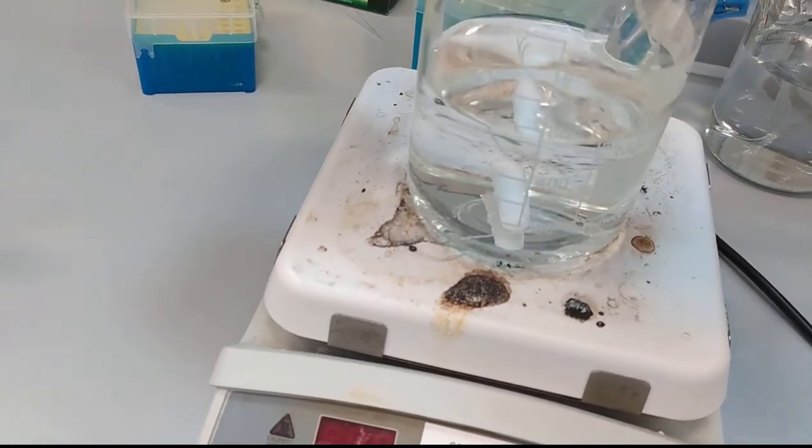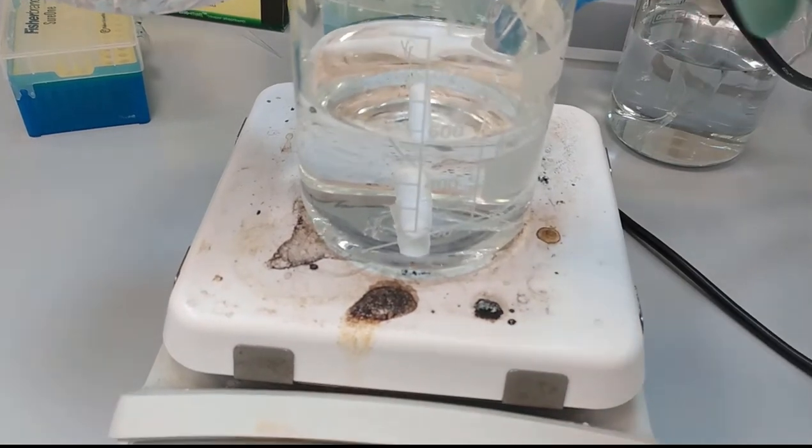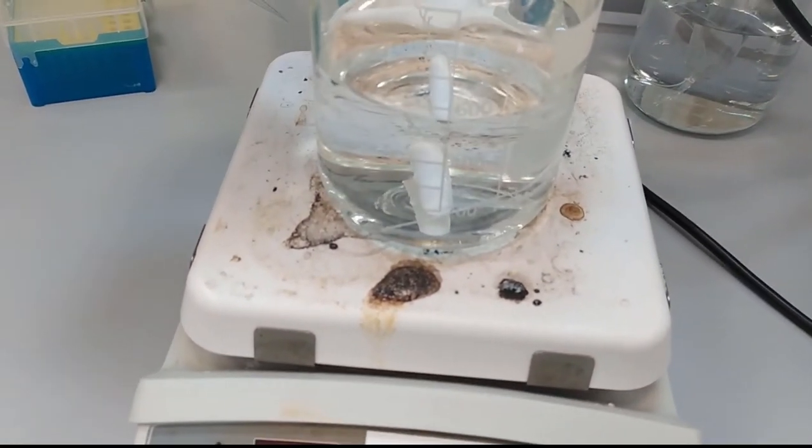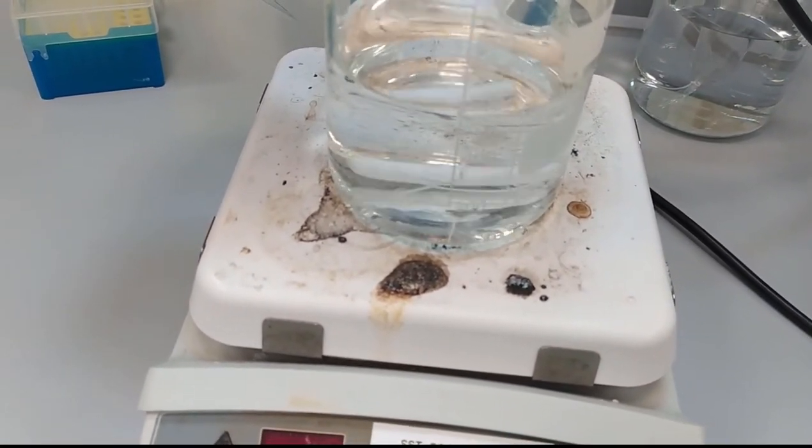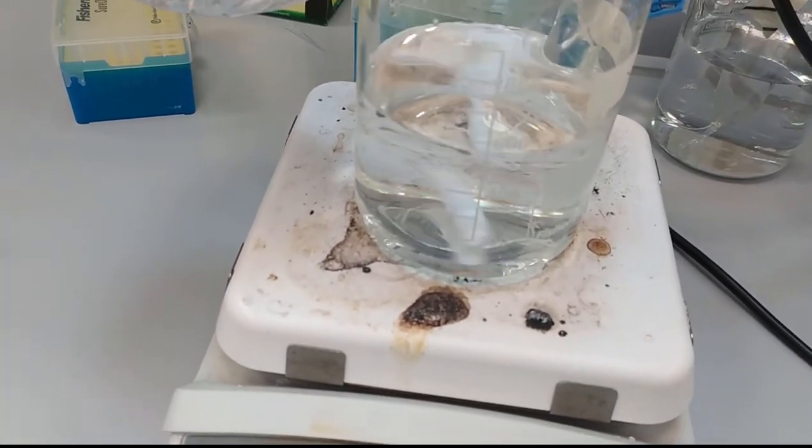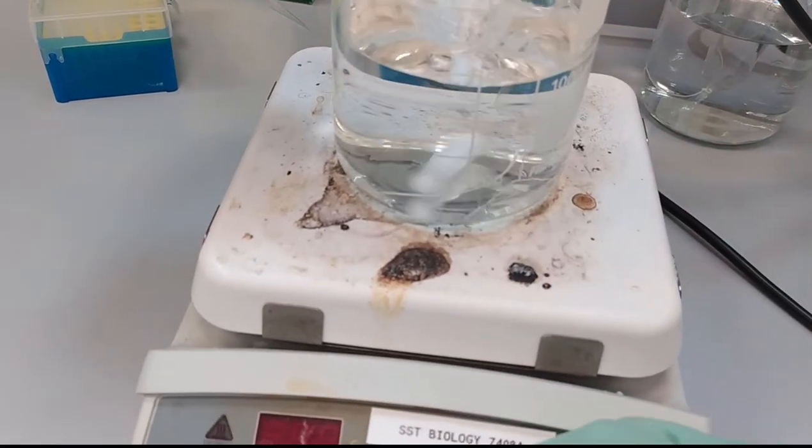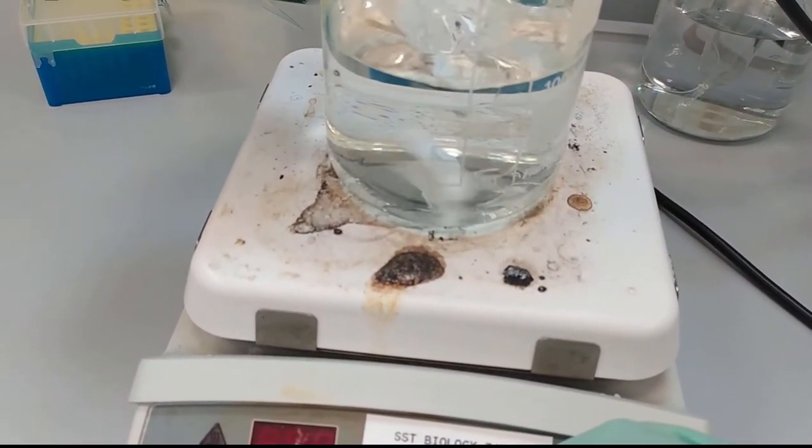As you can see, it stood on the place that is the magnetic rotator. And we set the rotations to the appropriate value, so let's say it's 350.